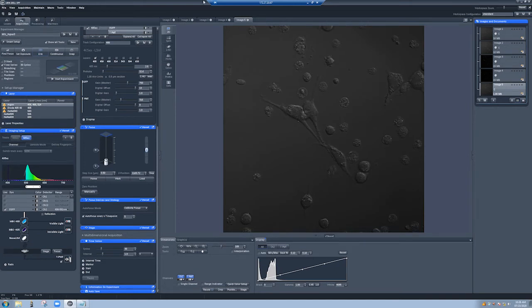So if we add multiple positions, we'll get more data, but we will be in a situation where we can't image as quickly. So let me just make the interval 30 seconds, and we'll just take 3 images.